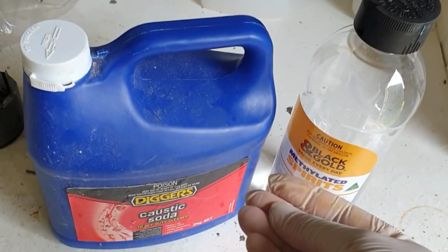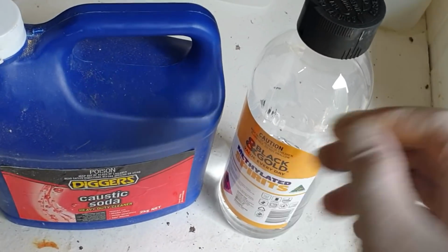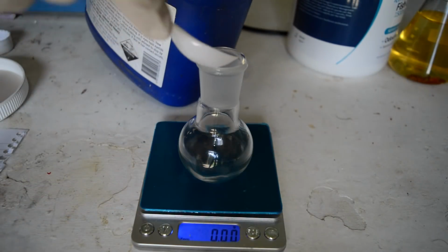I'm not going to use all our tribromide up, maybe a third of it or so, so that if this fast and loose method doesn't work, then we don't lose all our product, but we'll see what kind of yields we can get.